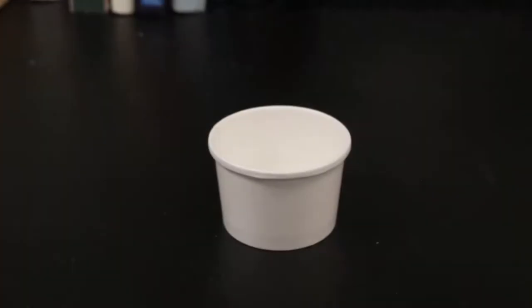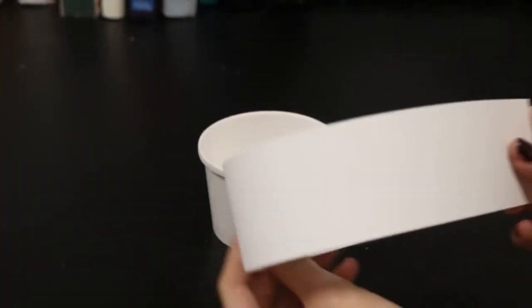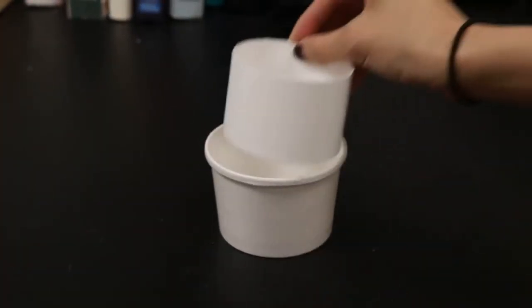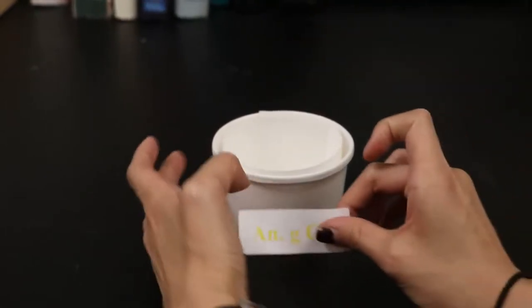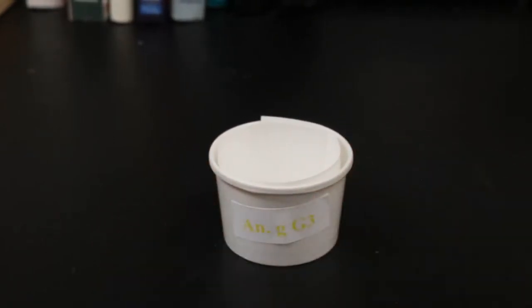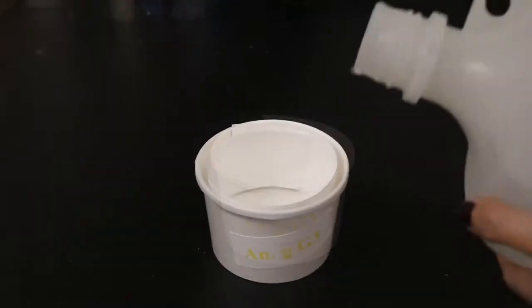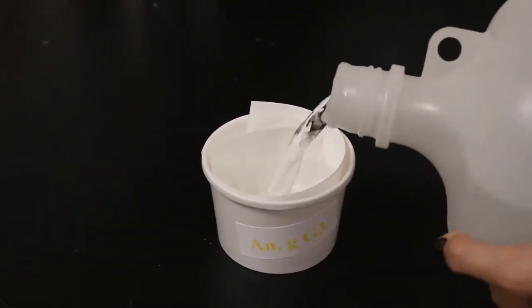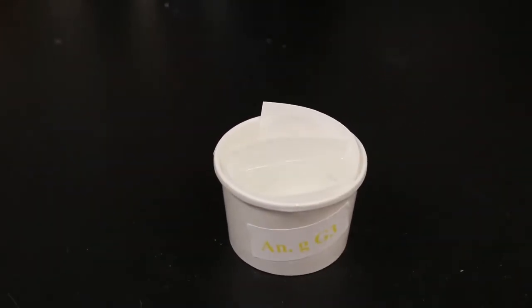To see more detailed instructions on how to blood feed a colony, please refer to the blood feeding video. Egg cups can be placed in a cage two to three days after blood feeding. Place a filter paper inside of an 8 ounce cup and add a label to the side. This will serve as an oviposition chamber to collect eggs. Fill the cup halfway with DI water and place it inside of the cage.